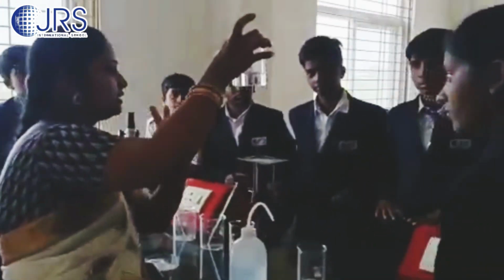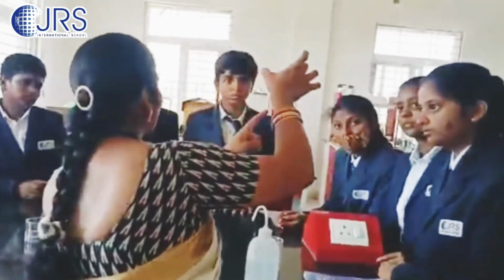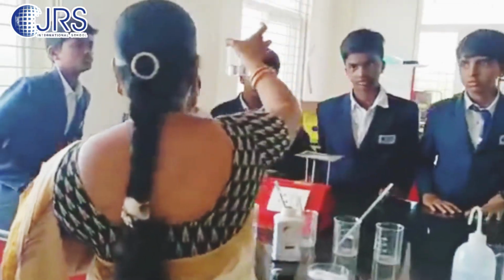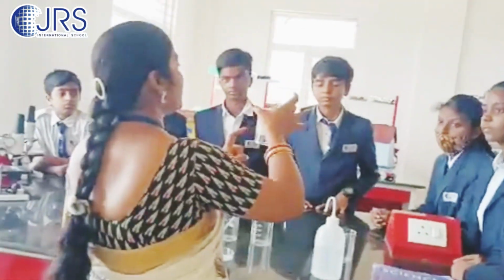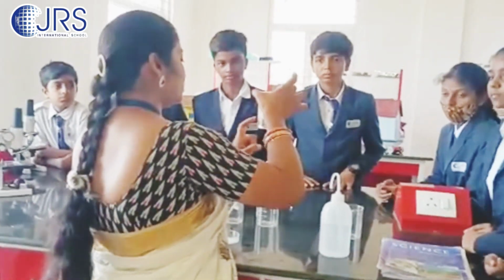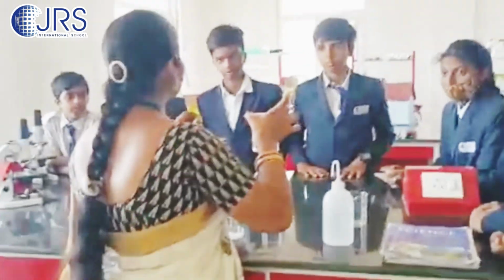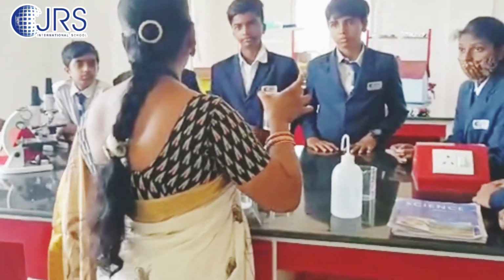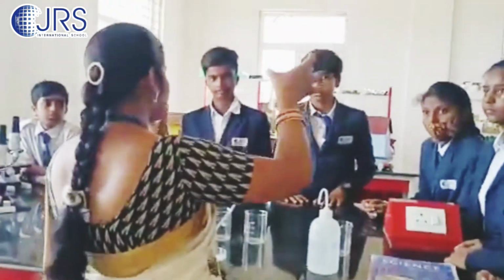Am I doing anything? No, nothing I am doing, but still the color will spread throughout the water. Yes or no? It was coming up. Yes. Without doing anything. Yes or no? This will show us that the particles of water are continuously moving, and I added only a pinch of KMnO4, showing that particles are very tiny in size, but still they will show the properties of the whole compound. Because it is just a pinch I added.